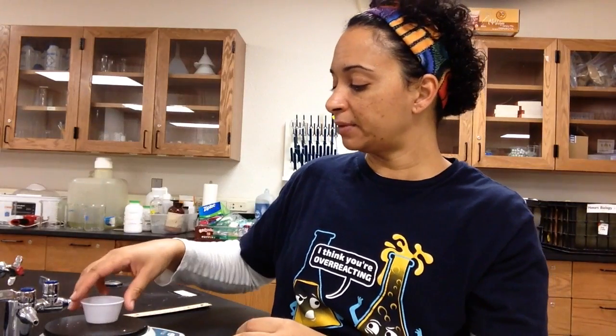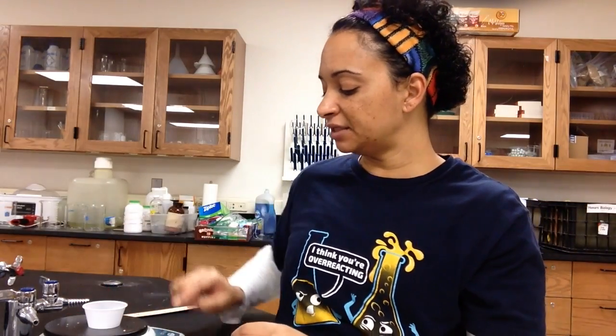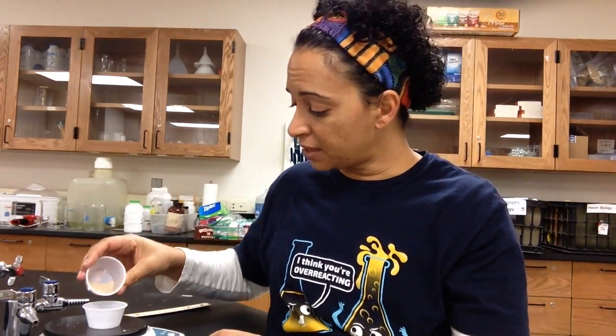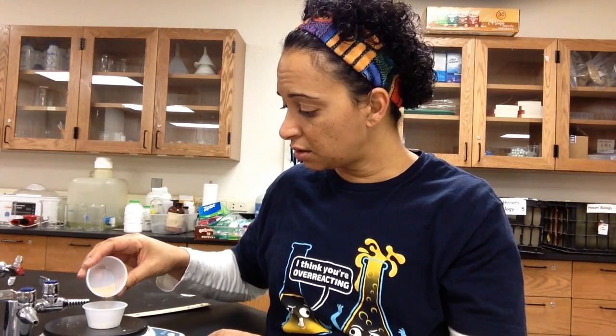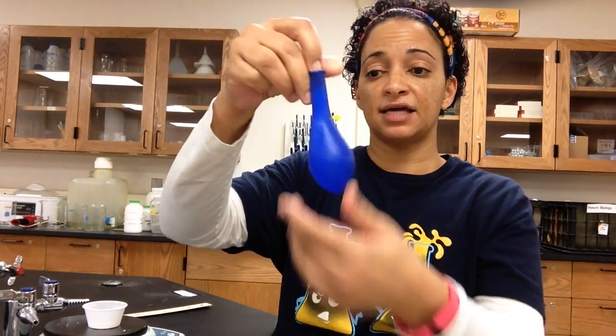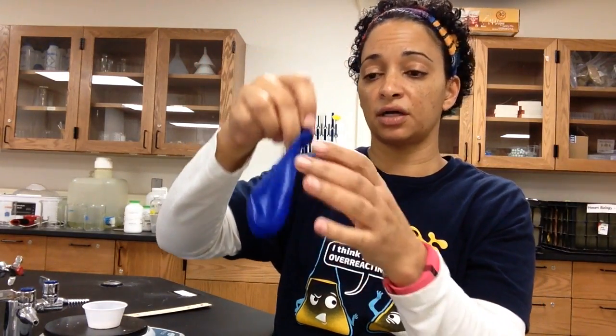Once I've done that, I'm going to get my tare cup, put it on my balance, and zero it out so that the balance doesn't see the cup. Then I'm going to measure out one gram of yeast. All right, I've got one gram of yeast.